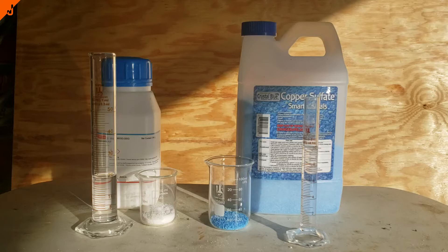Copper-2-bromide has multiple different uses. Specifically in organic chemistry, it can be used to brominate things. Similar to copper-2-chloride, it can also dissolve aluminum.